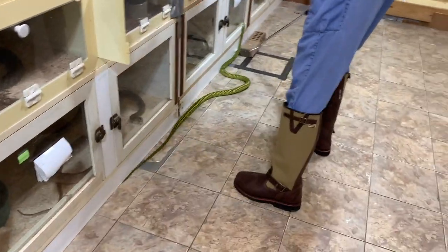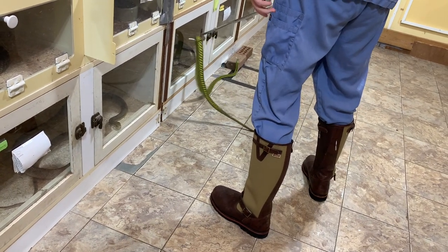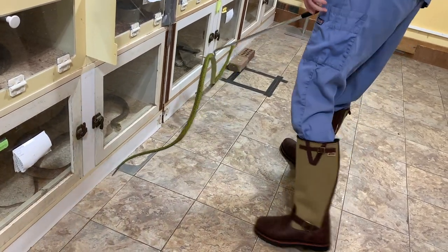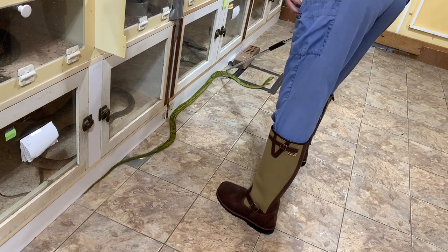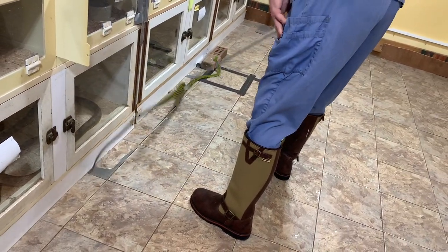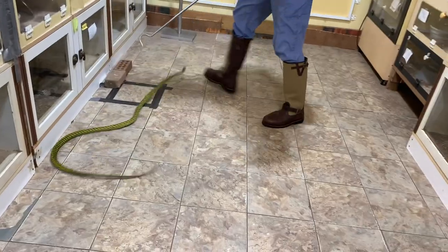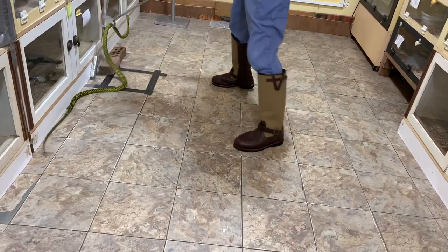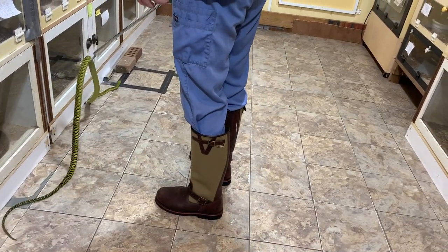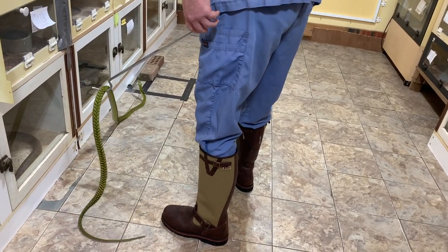The only solution here is to be patient. When Jim tried to get hold of the tail, the reason he did that is sometimes you can get the snake to lower its head when you lift the back end — that doesn't always work well for mambas, and it didn't work here. I'd like to point out that even though this is taking a few minutes and the snake is clearly trying to get away, it has not tried to bite at all. That last move was a little defensive — the snake backed up right as Jim was going to grab, so he stepped back.